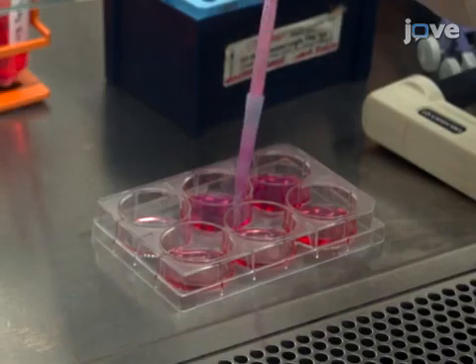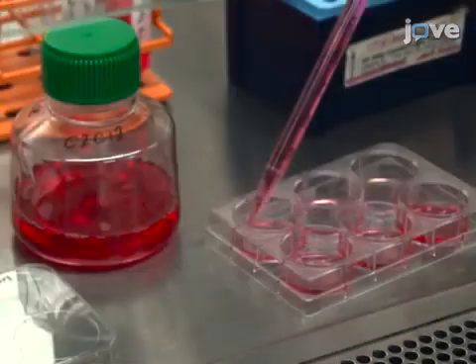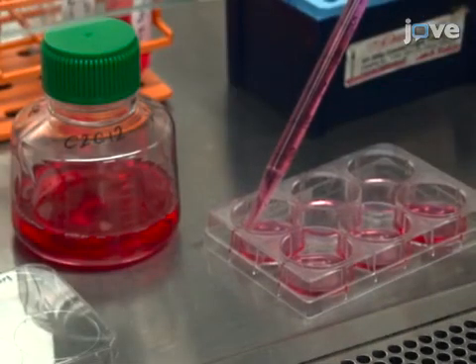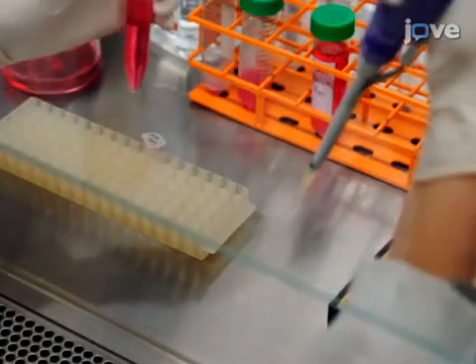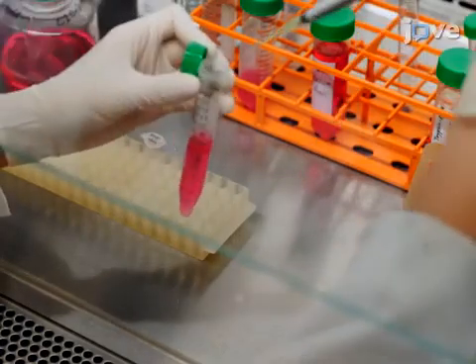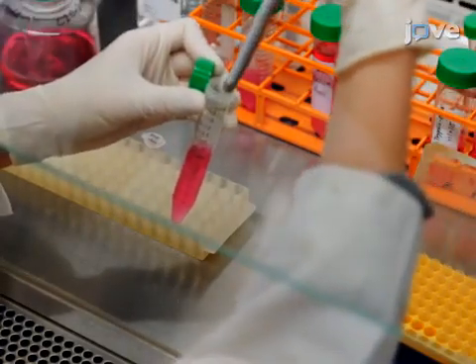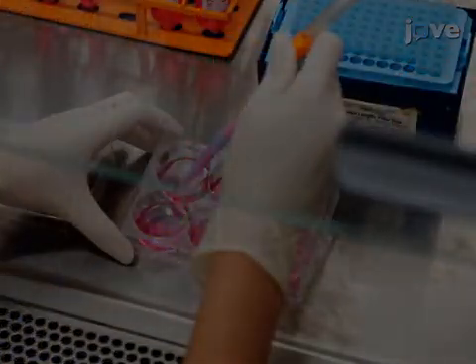If cytotoxicity is observed, replace the serum-free medium with growth medium. 48 hours after transfection, add the appropriate selection antibiotic in fresh growth medium every 2 days for 10 days until the control cells die.